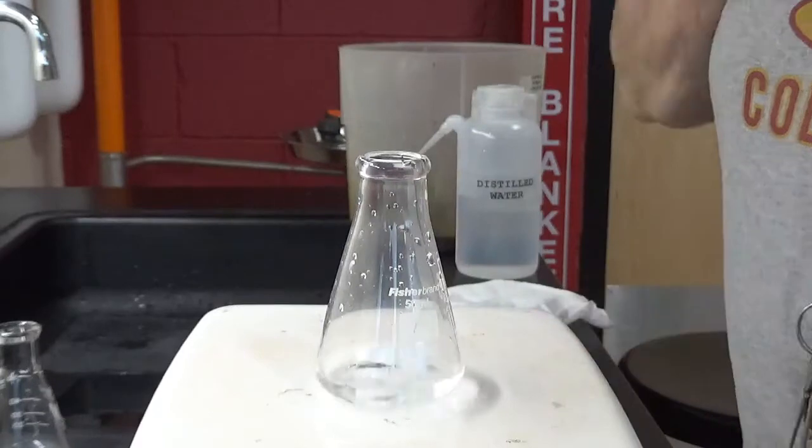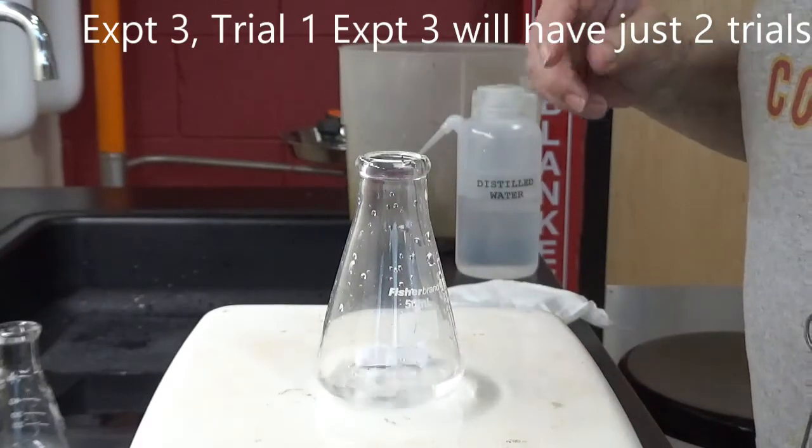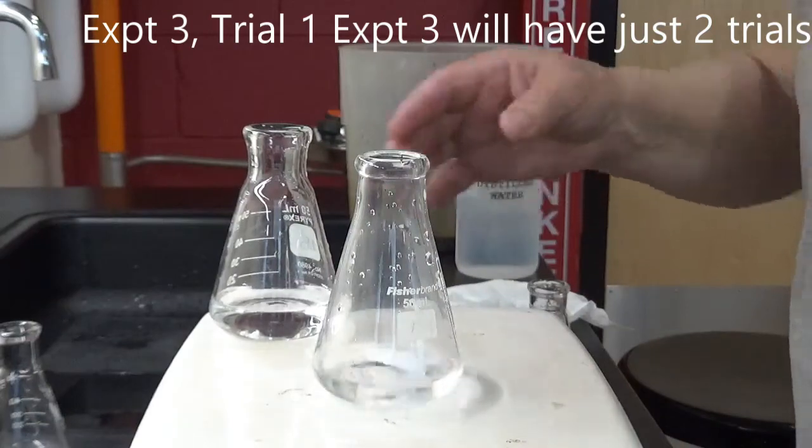This is experiment number 3, and I want it to be stirring. And I'm going to get the solution. This is solution A. This is solution B.